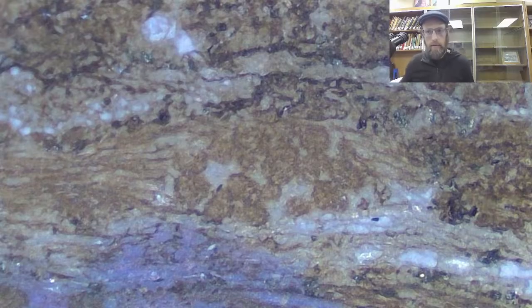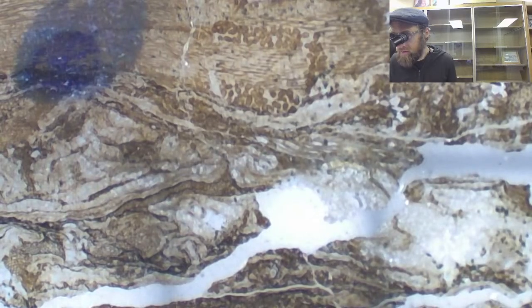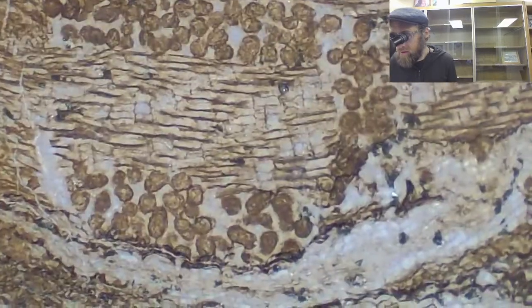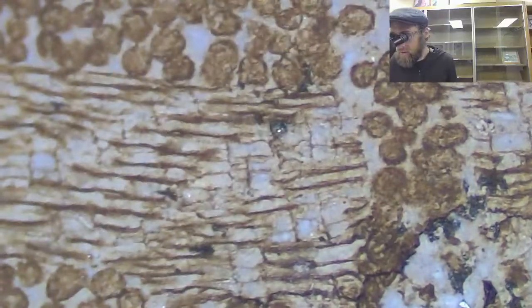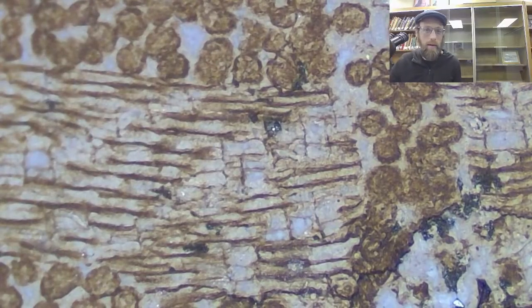Okay, so that looks like pollen-filled coprolites, I would say, and it's marked on there. Yeah, so strange. Why would they be all tucked away like that? I kind of don't understand that.